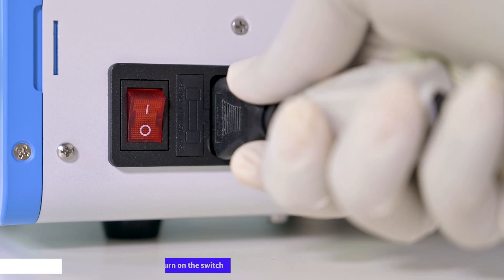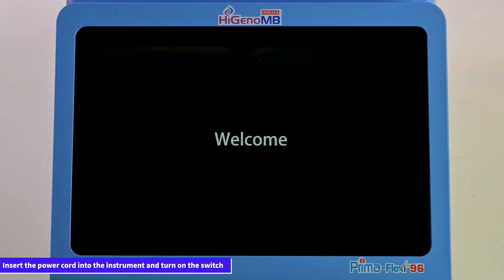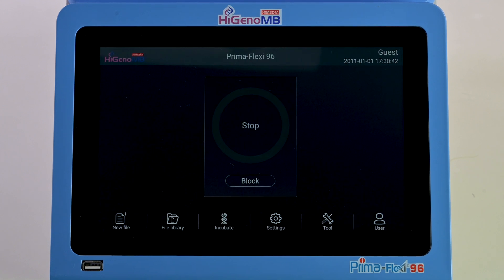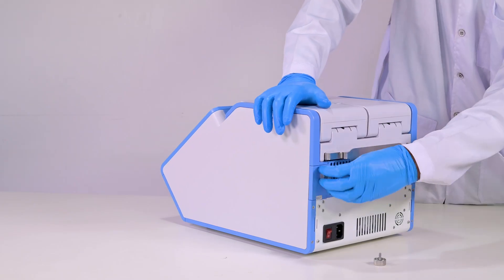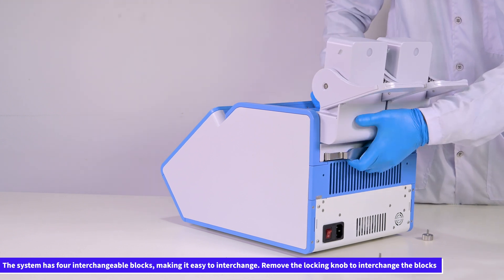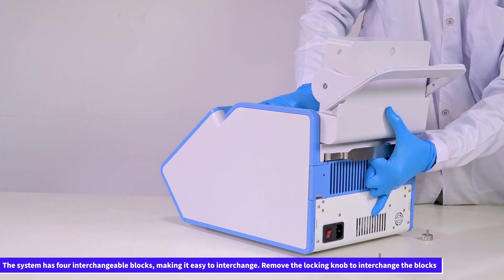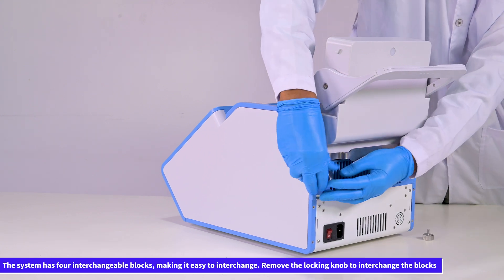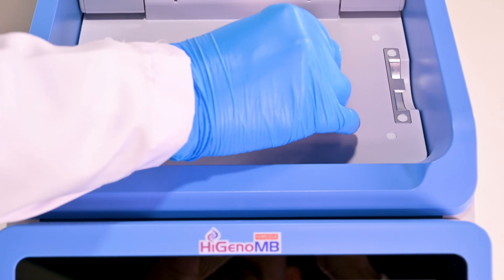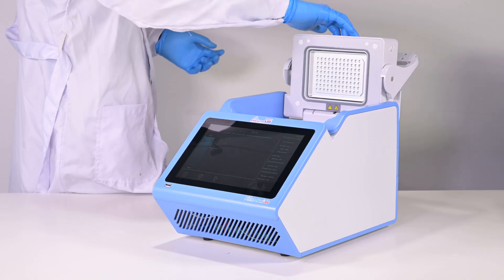First, insert the power cord into the instrument and switch it on. To interchange blocks, simply remove the locking knob. The system comprises 4 interchangeable blocks for your convenience. Place your tube, strip, or plate in the block and ensure to close the lid.